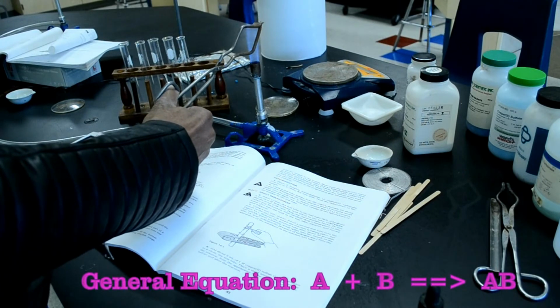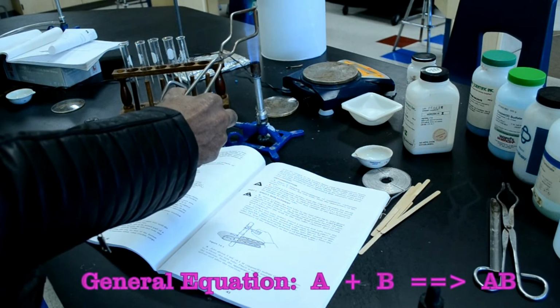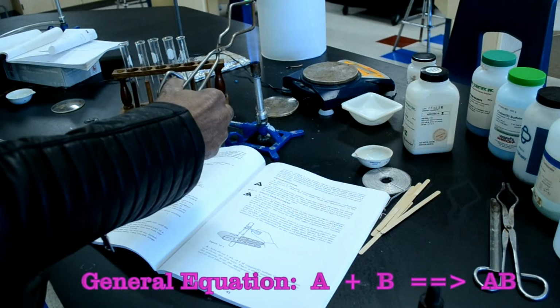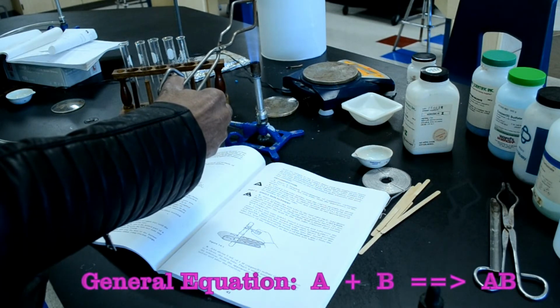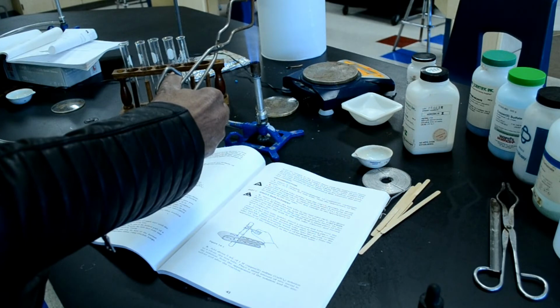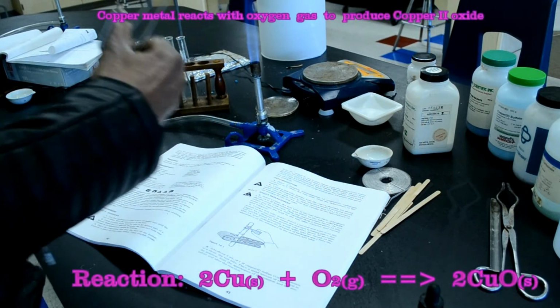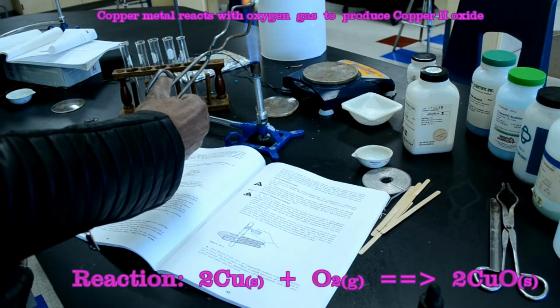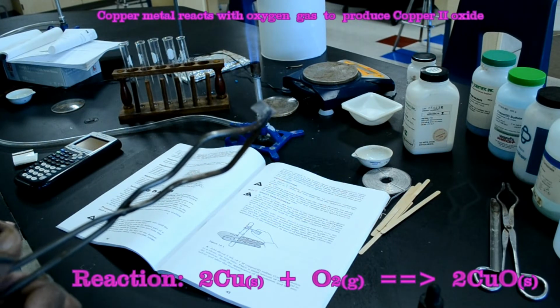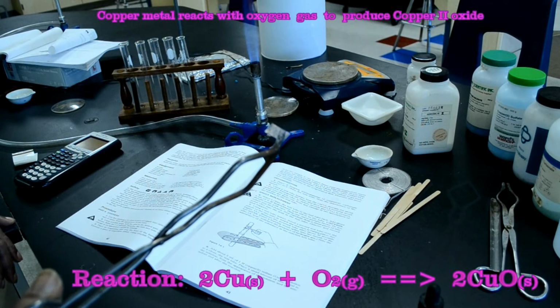So we're going to place the copper metal in the fire, the hottest part of the flame, and you see copper actually burns greenish. That's actually part of something called a flame test, where copper will burn green. And we see that the copper is no longer a reddish color, it is now a blackish gray color. That's because the copper has reacted with oxygen in the atmosphere to produce copper 2 oxide.